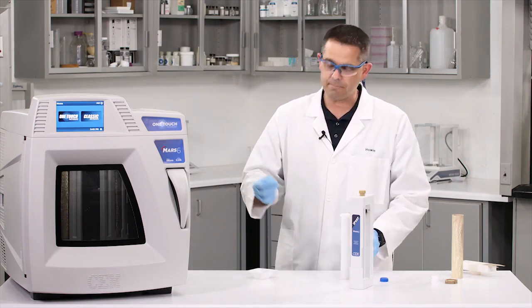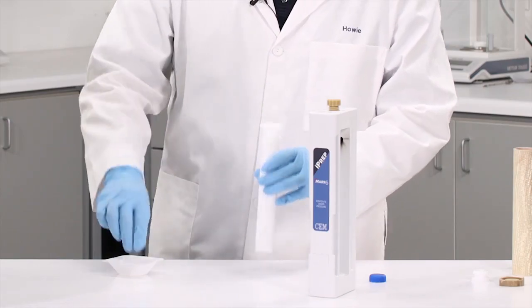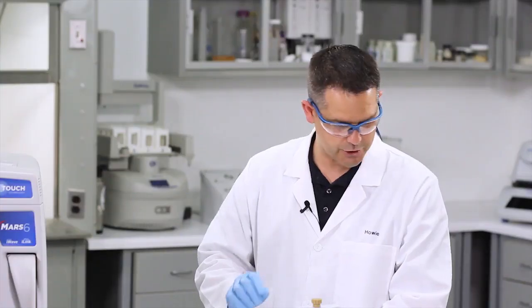Yep, that looks about right. You know what, let's just add another pinch. And here's our 10 milliliters of nitric acid that we're going to use.